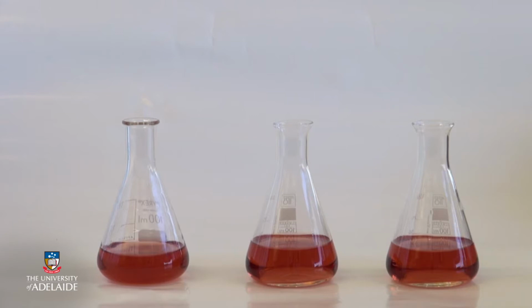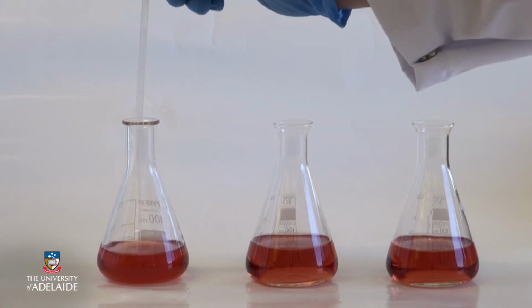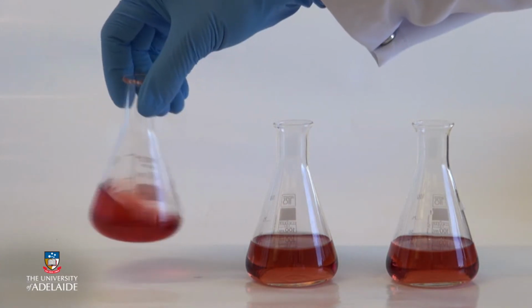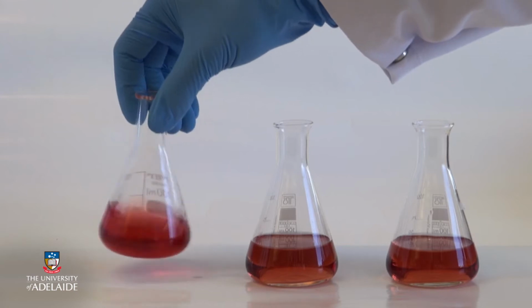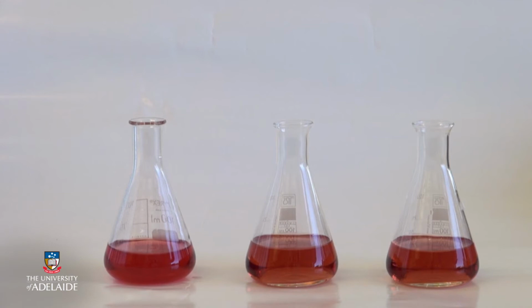Here, acid is being added to the wine on the left, drastically decreasing the pH of the solution. The wine was pH 3.55, but after adding acid it would be more like pH 1. Almost instantaneously the colour of the wine becomes deeper and more red. This is because the anthocyanins express the most redness at very low pH.